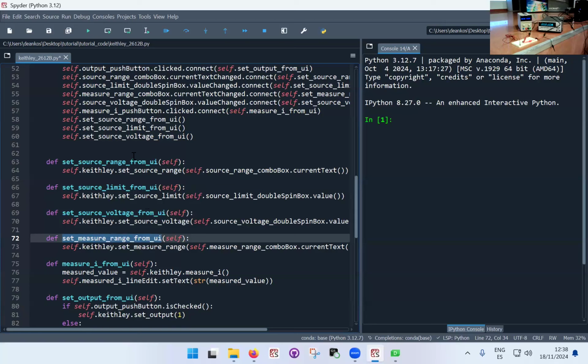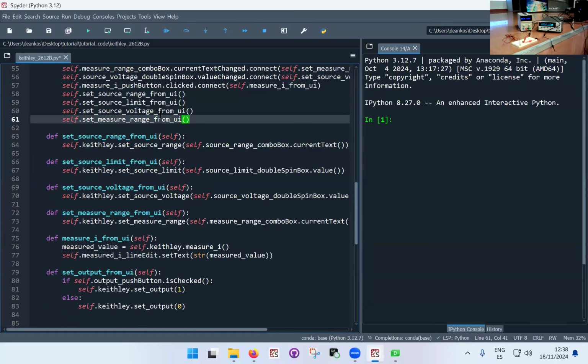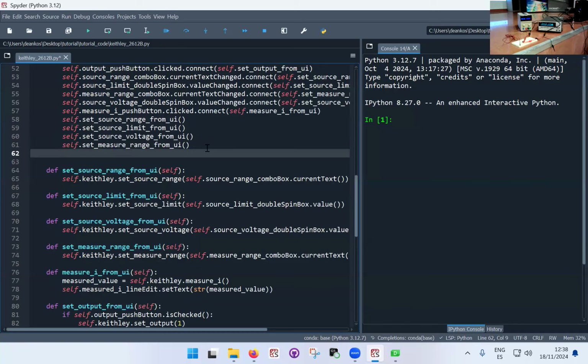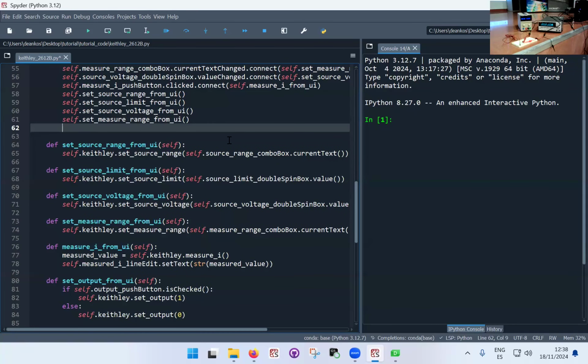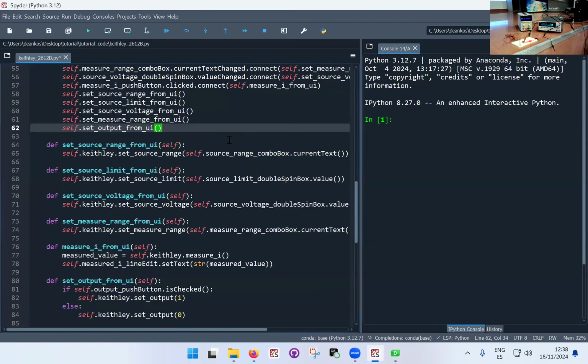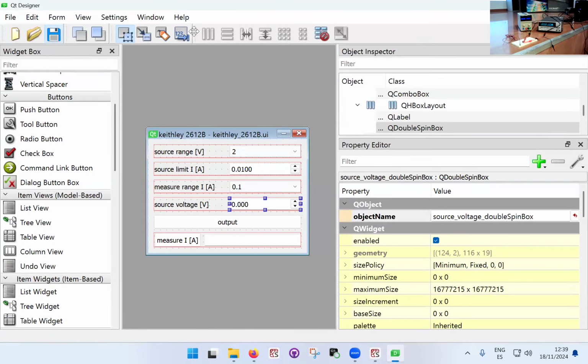So all I need to do here is all the set functions, and these will all execute from the from UI function. So even though I'm not pressing anything, the connection just tells the program to connect these functions to these buttons. But as I said, you can use these functions as normal functions for everything. Okay, so this way now the Keithley is going to have exactly these settings every time I execute it.